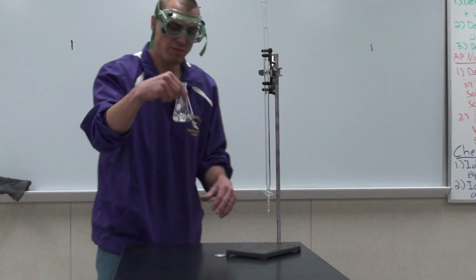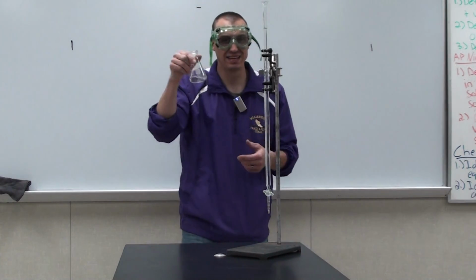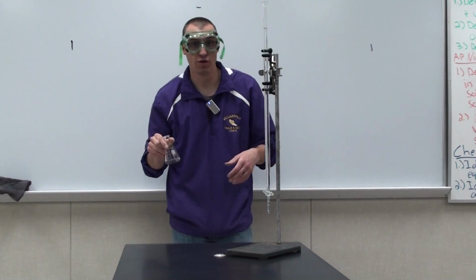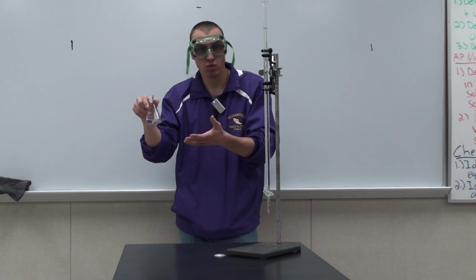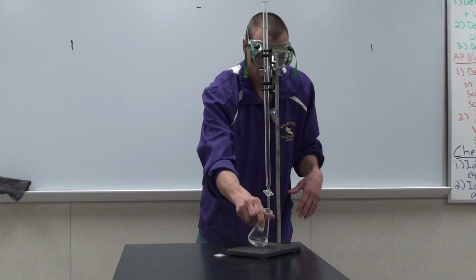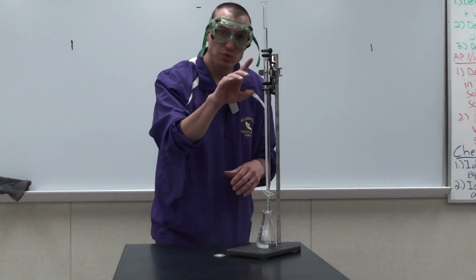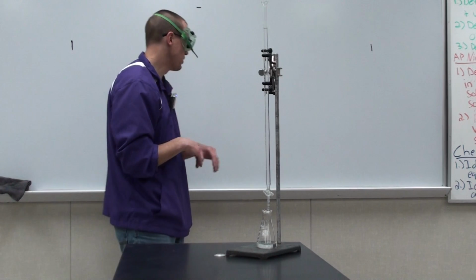So after 1 milliliter of NaOH has been added to this flask, you can see that this flask is still clear. And because of the phenolphthalein indicator, a clear solution means that we're still on the acid side, or we have a pH below 7. Now we want to see what exactly is that pH, or what exactly happened as we added this 1 milliliter. So let's go to the board.